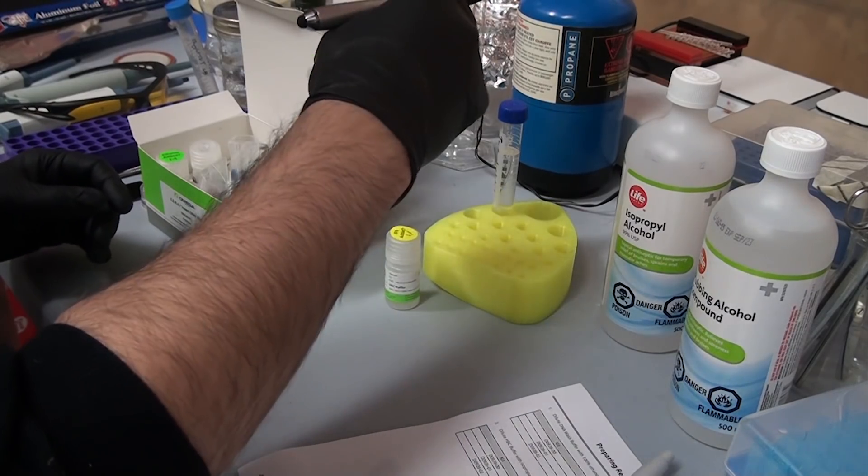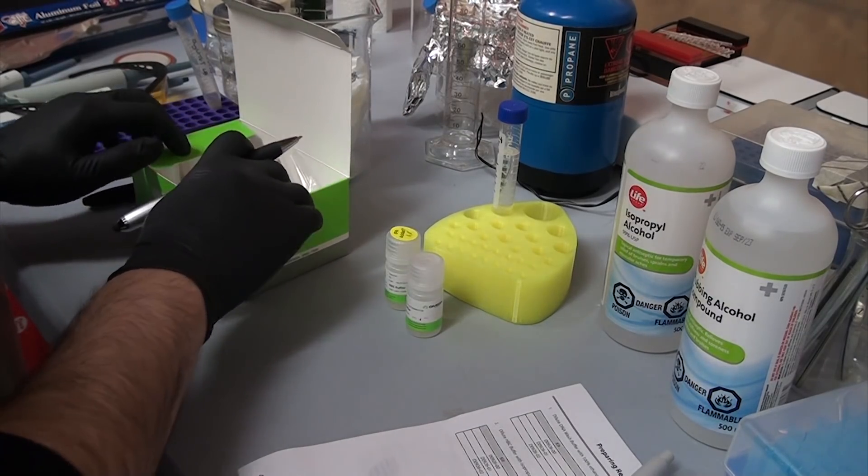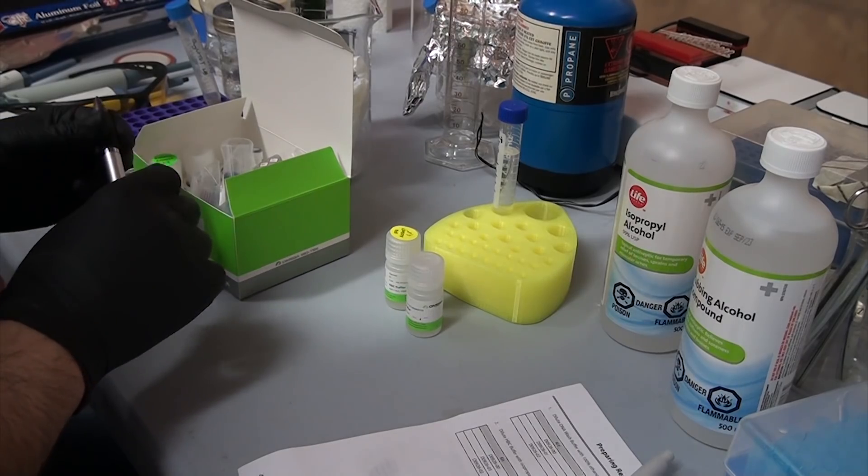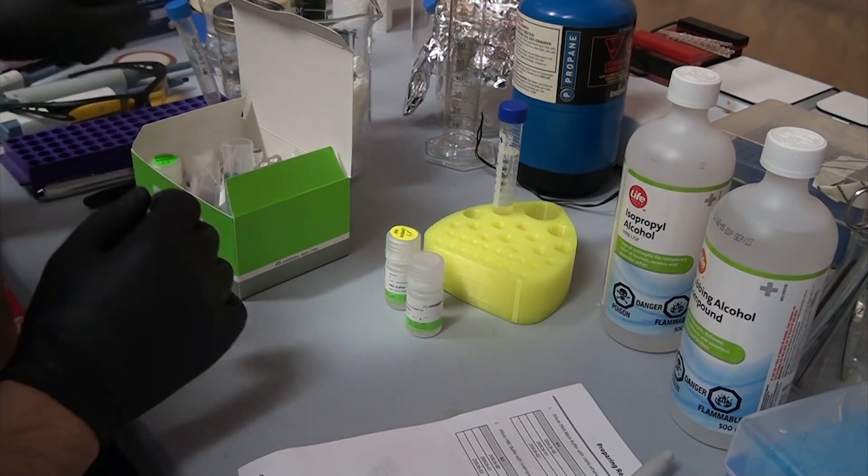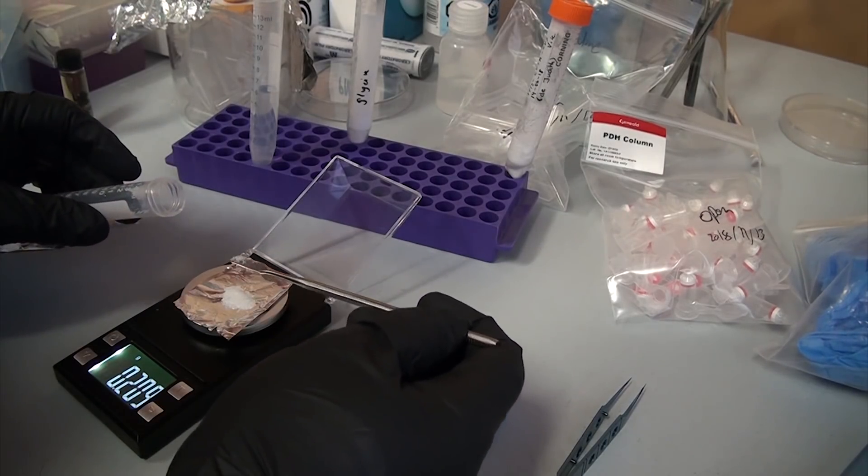Most of the time when you do this, you buy the tubes as a kit that come with all the different solutions you'll need. The manufacturers tune the solutions in each kit to work for their particular application, so if you try and mix and match, your results can be pretty poor. Right now I have two different kits, and I even tried mixing up my own solutions, though that didn't work very well.